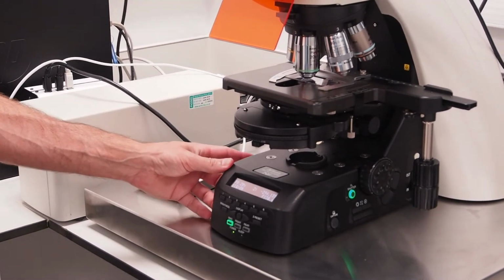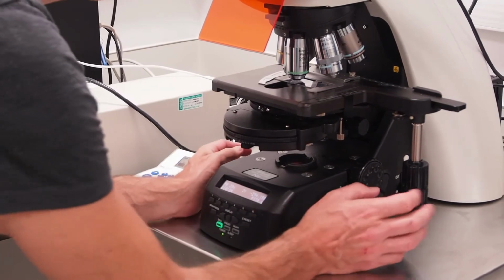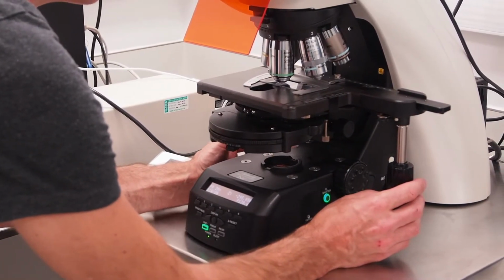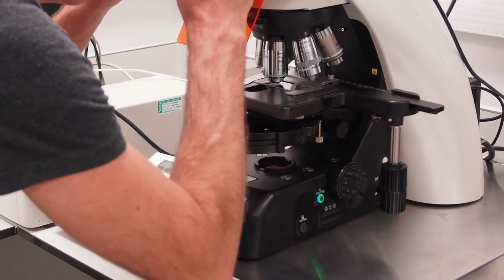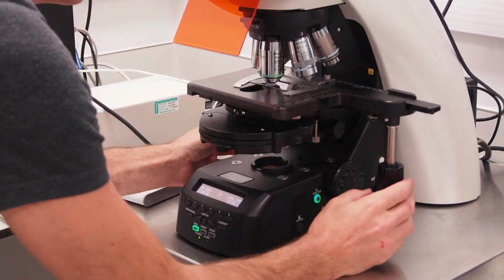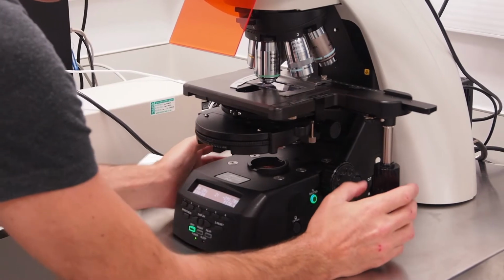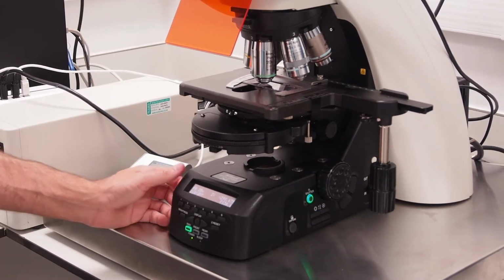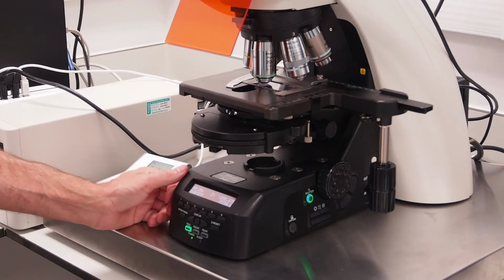Once it is in position, use the On button on the lower left of the microscope body to switch the bright field lamp on, and then use the focus knob and stage control to find your sample and focal plane, ensuring the oculars are set to the right interpupillary distance for your eyes. Once you have found a suitable field of view, switch off the bright field lamp by pressing the On switch again.